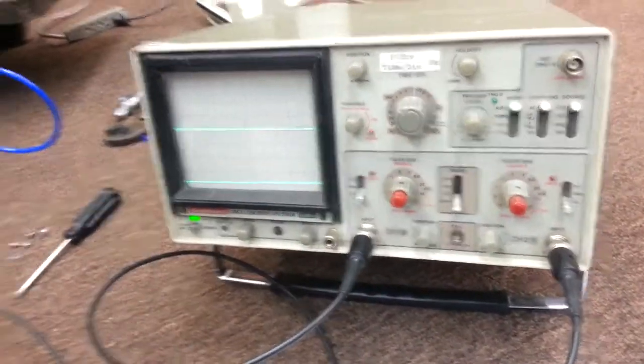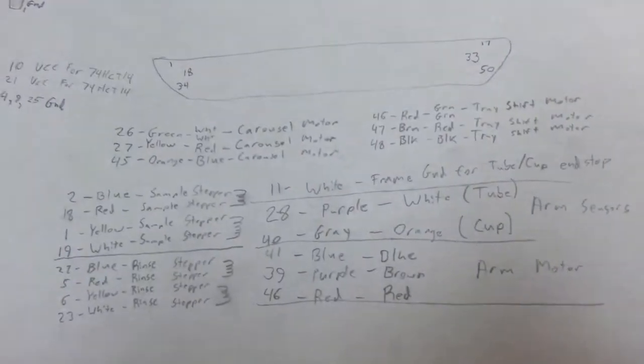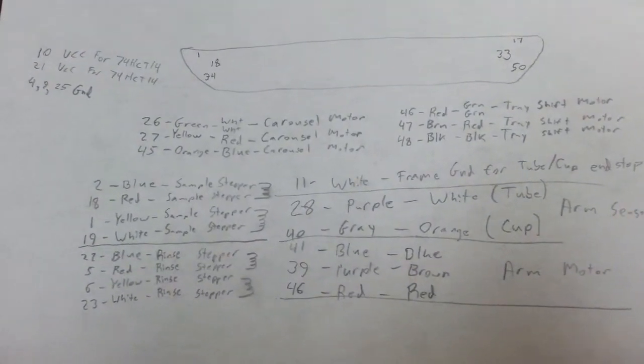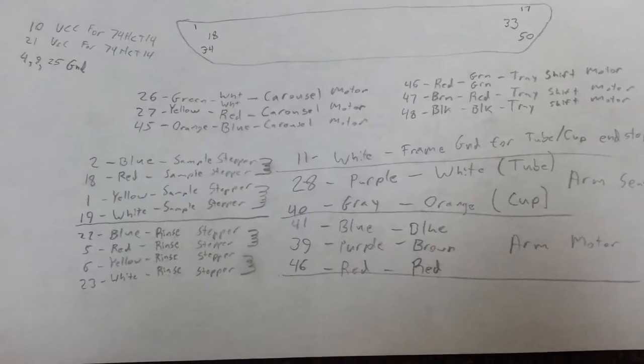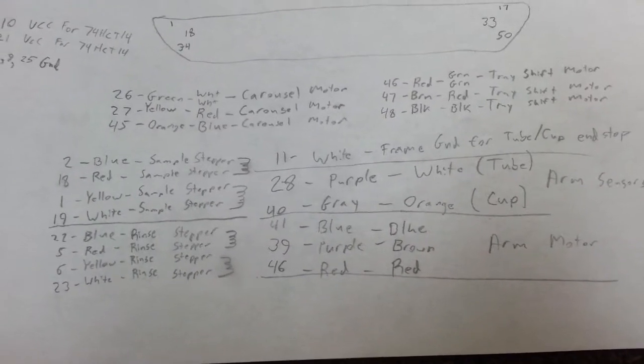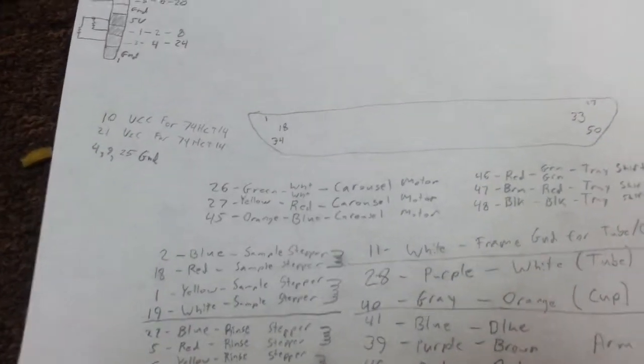I got a part of it hooked up to the oscilloscope here, and what I've been able to determine so far is, well, first of all, traced out a bunch of the cabling on the auto sampler. And we figured out where some of the signals go for the stepper motors as well as the sensors for the end stops on those stepper motors.